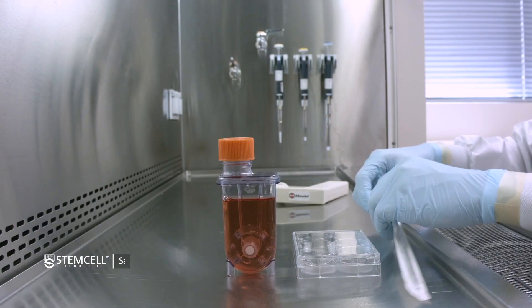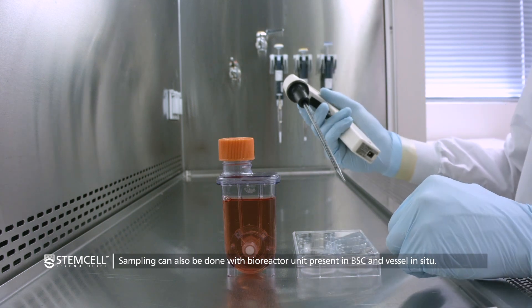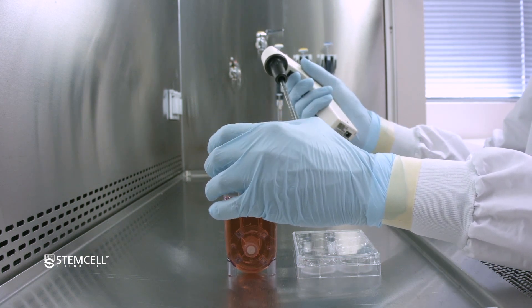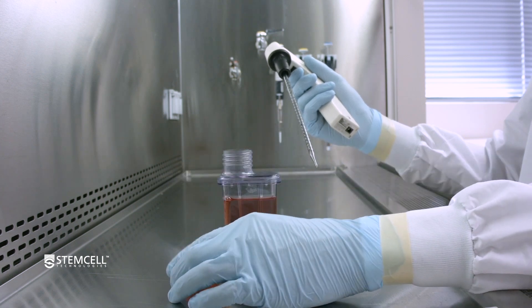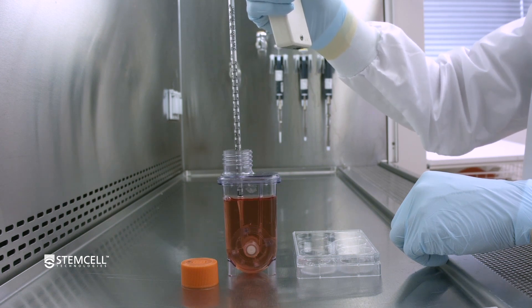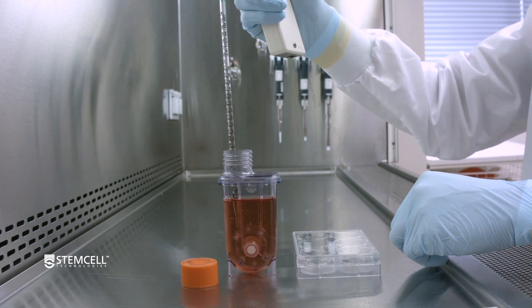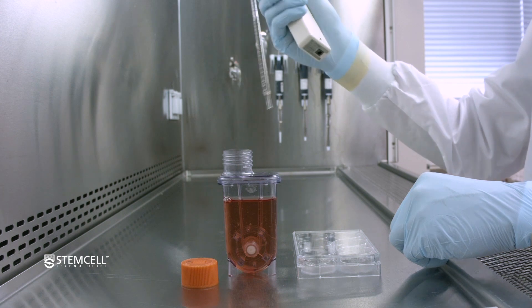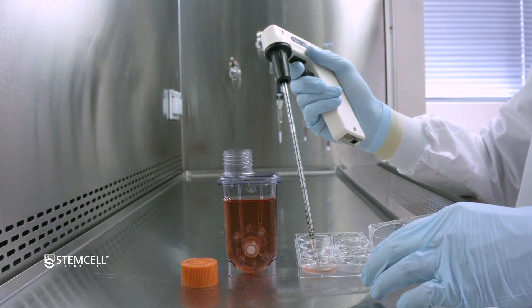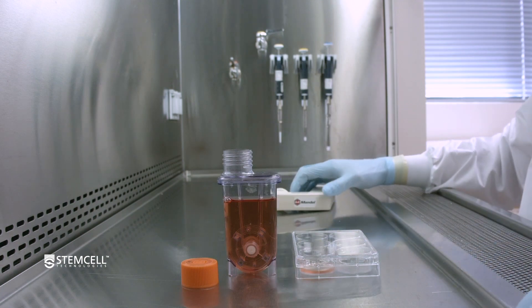The first step in passaging the PBS Mini is to take an aggregate sample for imaging. Imaging the aggregates is important to evaluate the aggregate size and morphology. Working aseptically, remove the cap from the PBS bioreactor and place it face down. Using a 2 ml pipette, aspirate 2 mls of the culture. If the aggregates are settled, gently rotate the vertical wheel with the 2 ml pipette to resuspend, then take your sample. Distribute the sample in a non-tissue culture-treated 6-well plate for viewing on the microscope, then return the cap to the PBS bioreactor.